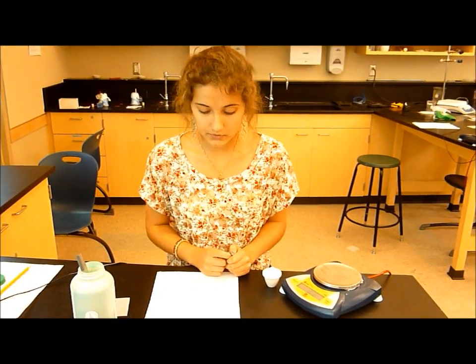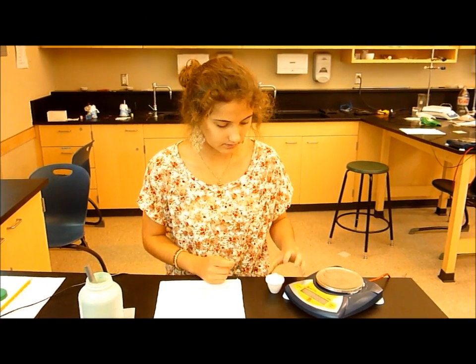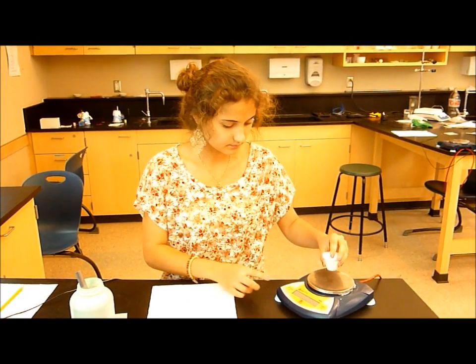Okay, so step one, measure and record the mass of a clean, preheated crucible and cover.